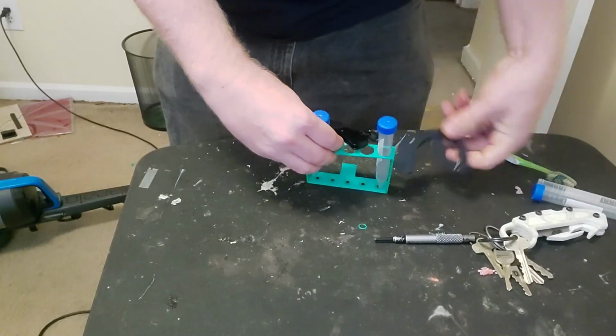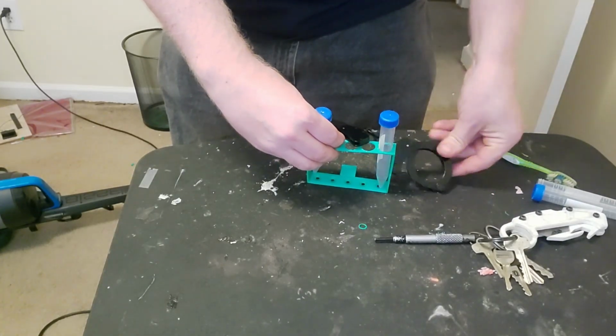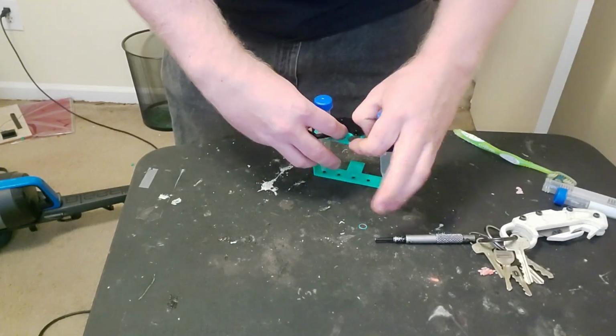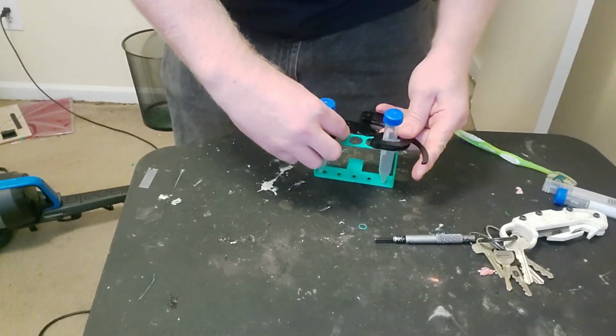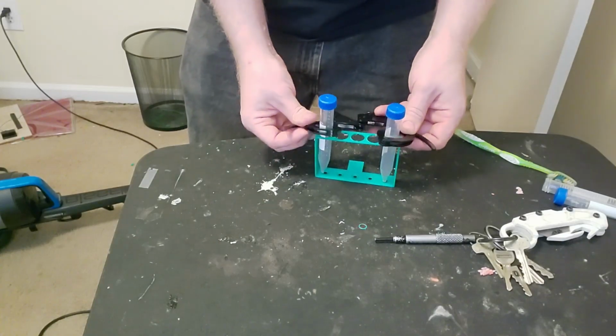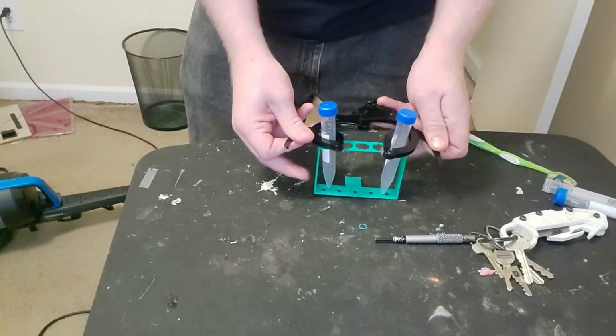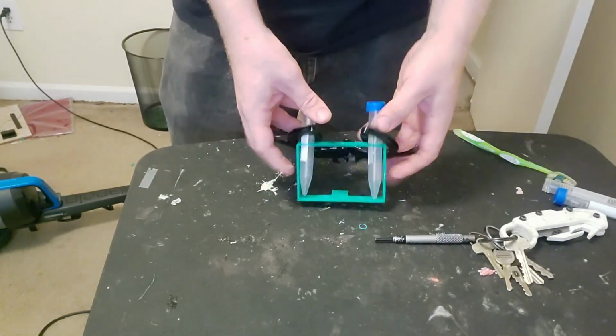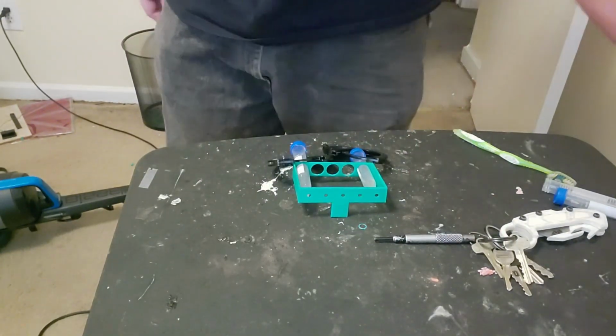So, if we don't want to have all that excess material keeping our tubes further apart, what we really want is something modular. Different tube racks, or different tube holders rather, that we can swap in and out on the same tube rack. So, at this point in the video, allow me to climb atop the shoulders of some very tall giants and introduce gridfinity.